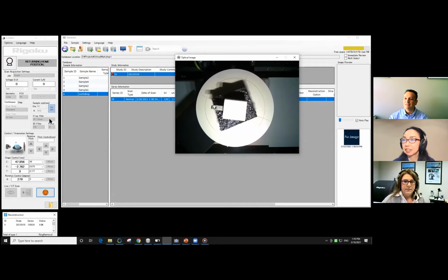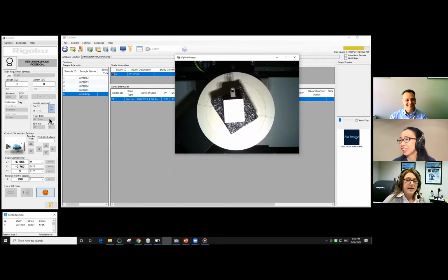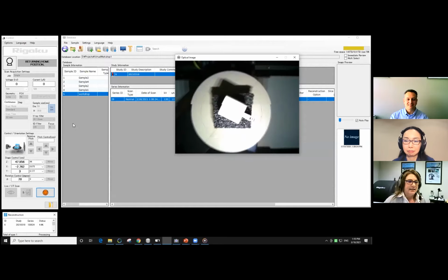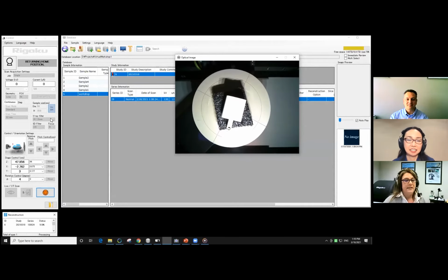All right. So it's returning back to 0. That's a really good catch. Yeah, that's something I should have caught. If I came back later, I would be under the mistaken impression that I collected it using an aluminum filter rather than the copper. And that's just a drop-down choice as well for whichever filters you have. Yeah. All right, so it's returned to 0.